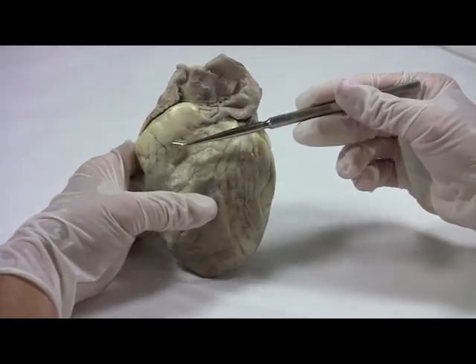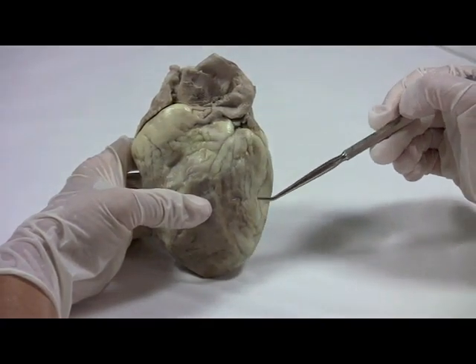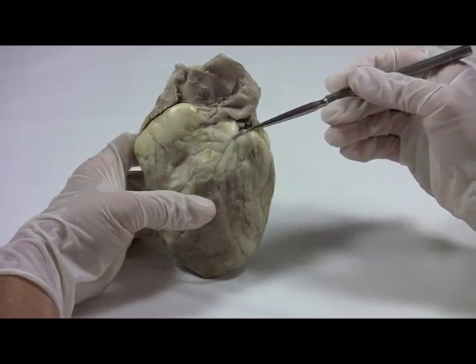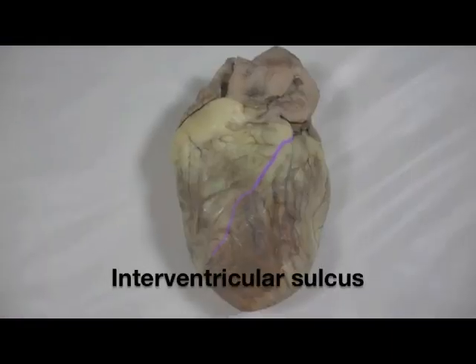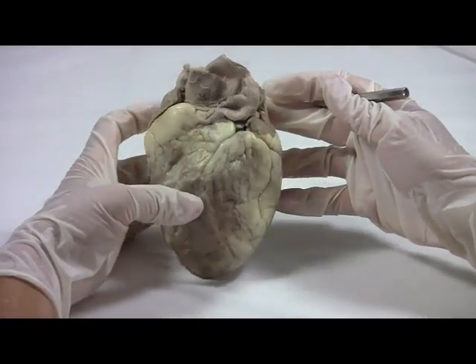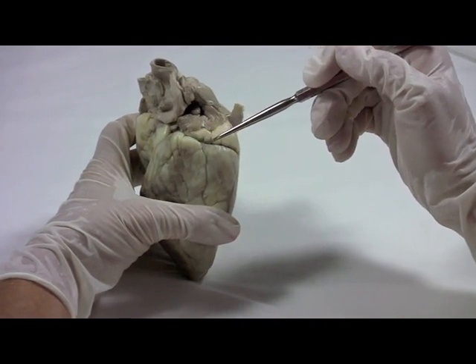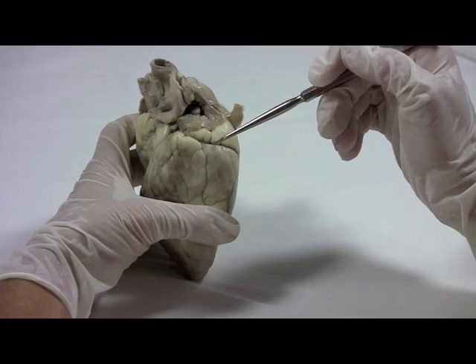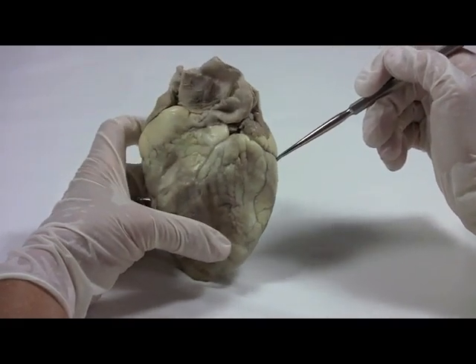We can see a lot of adipose tissue on the surface. That's typical. And you can see grooves on the surface where the coronary vessels travel. This is the interventricular sulcus. And this is the coronary sulcus. The coronary vessels that travel through these pathways provide oxygenated blood to the heart itself.